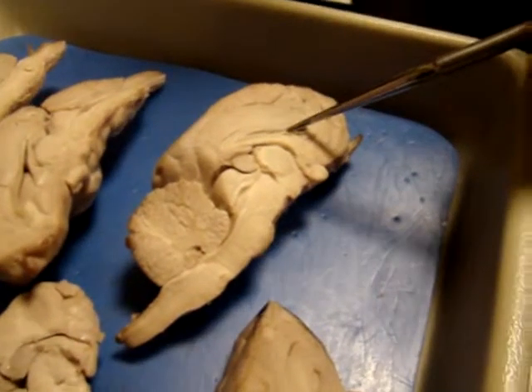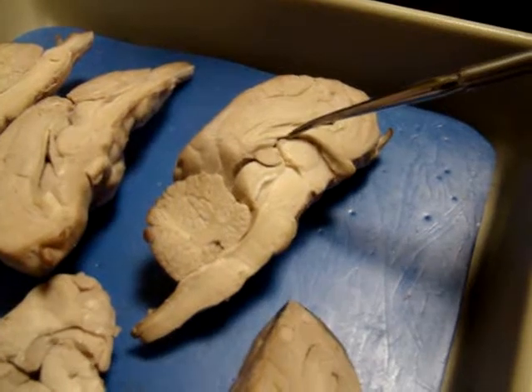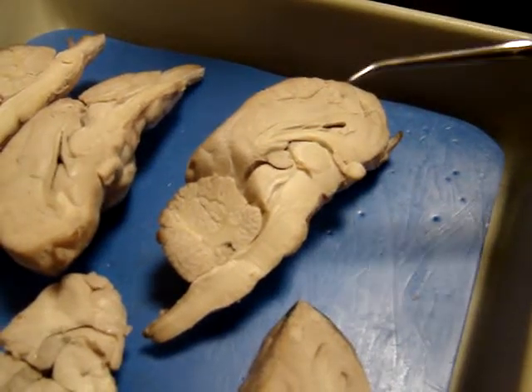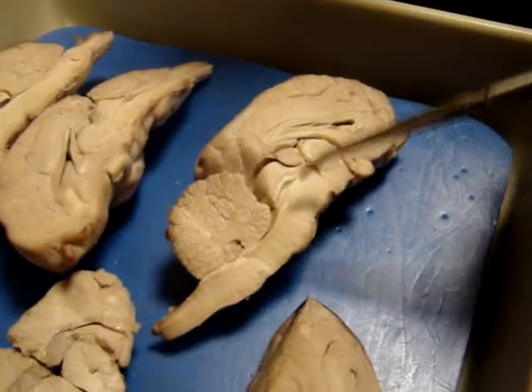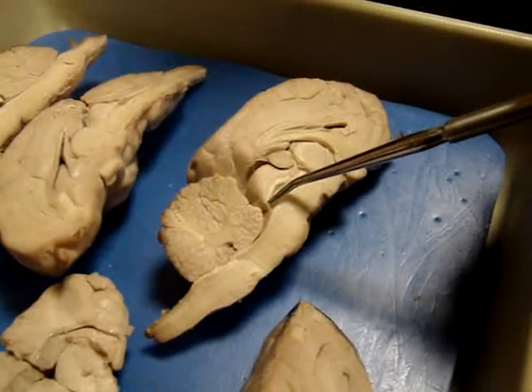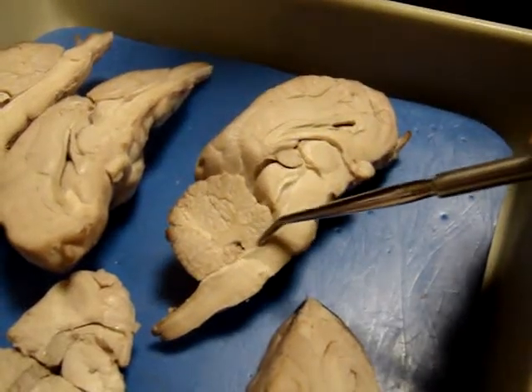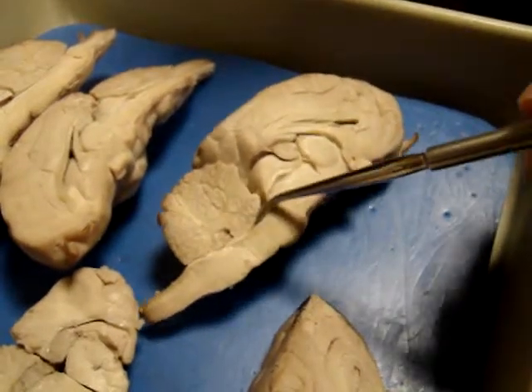So we have the lateral ventricles up in here, and underneath here we have the third ventricle, which is between the thalamus and the fornix. And that connects to the cerebral aqueduct. Actually, it doesn't look like it connects directly from the way we cut it, but it passes between the colliculi and the midbrain, in this area. And then it connects downwards into the fourth ventricle, which is between the cerebellum and the midbrain. So this gap in here.